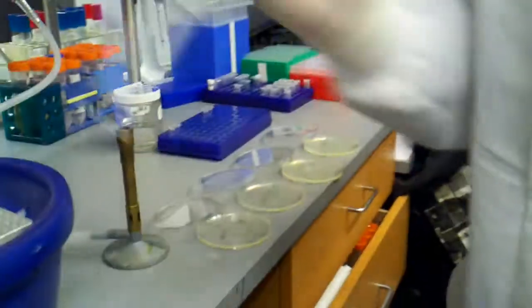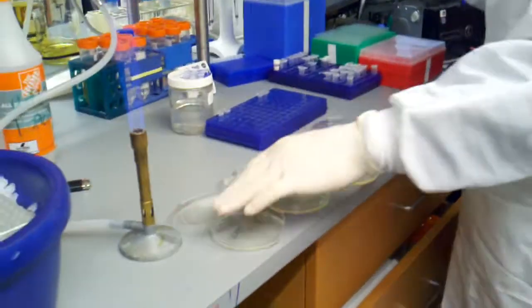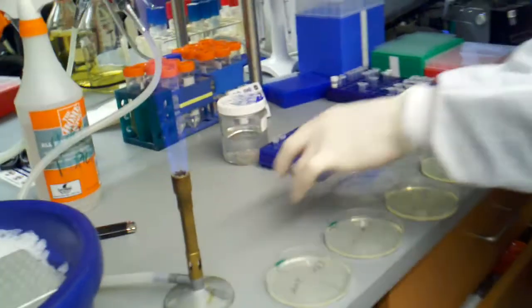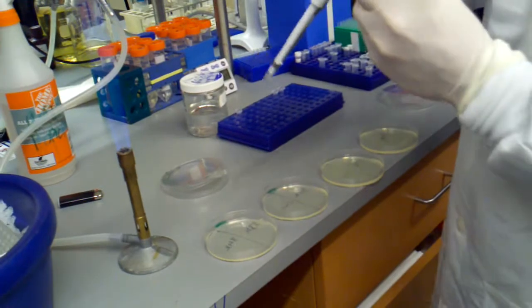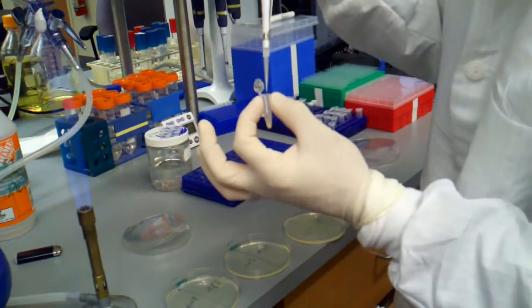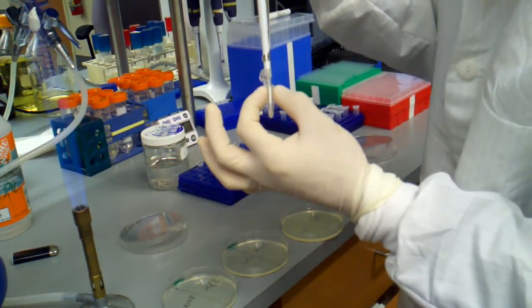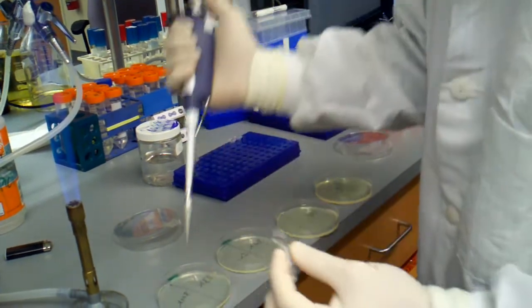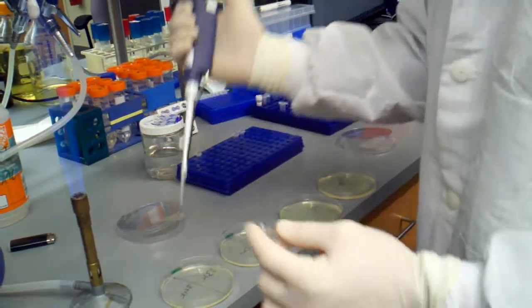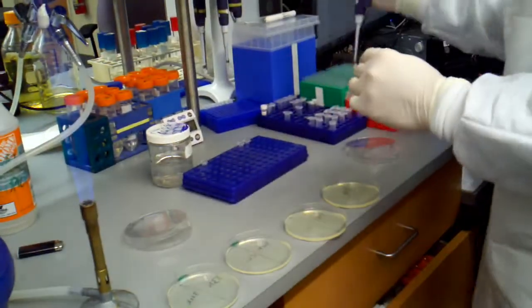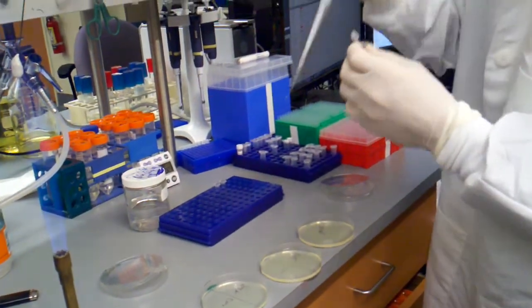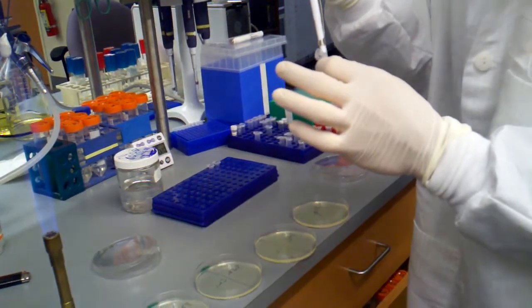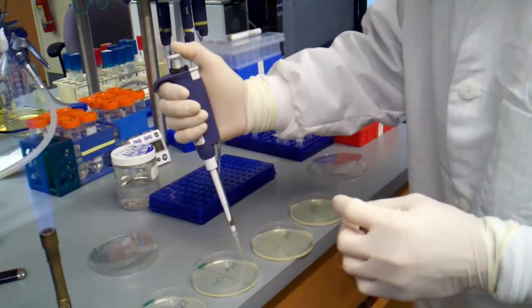So what I do is I just spread all of my cells out at one time, so 34K gets resuspended and then plated. And I'm plating all of my cells. Some people don't do that, but I like to make sure that I get some colonies, so 35K.